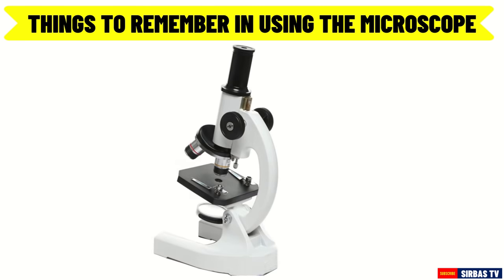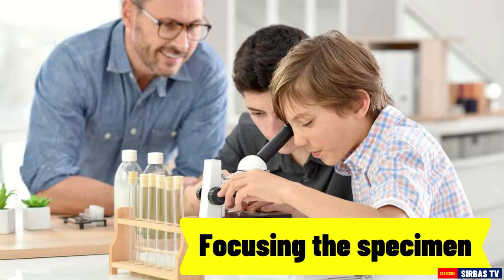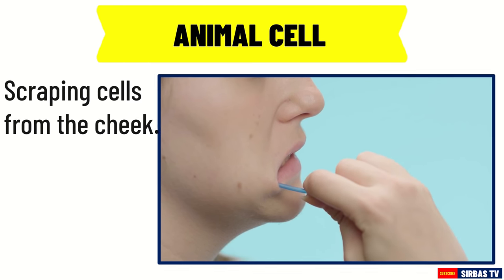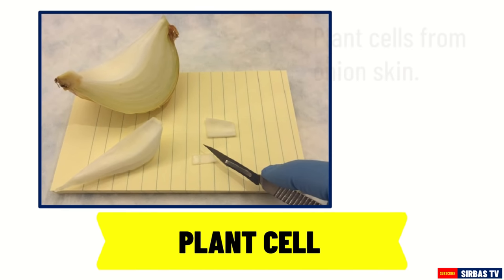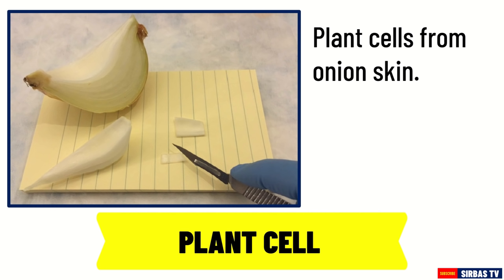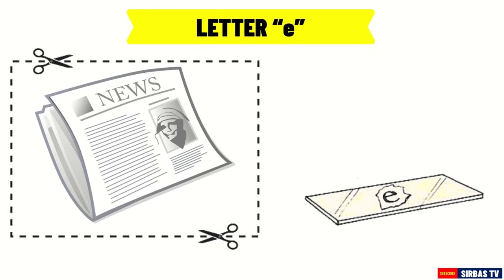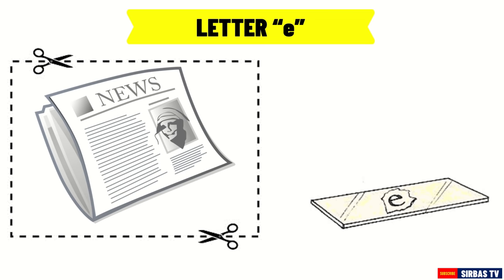Let us now learn the ways on how to examine and focus specimens. The specimen to be used depends on the topic that you want to study. If you want to study the animal cell, you can scrape a tiny bit of sample from your cheek using a clean toothpick. If you want to study a plant cell, you can use the skin of an onion. When using a plant or animal specimen, make sure to slice the sample thinly in order for light to pass through. In this video, we are going to use the letter E cut out from a newspaper as a specimen, as practice before using specimens of organisms.